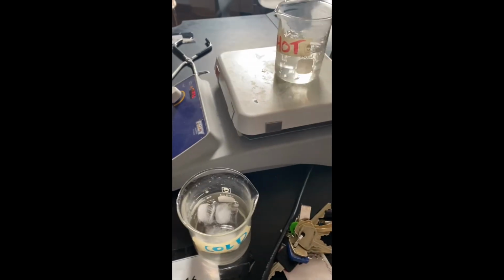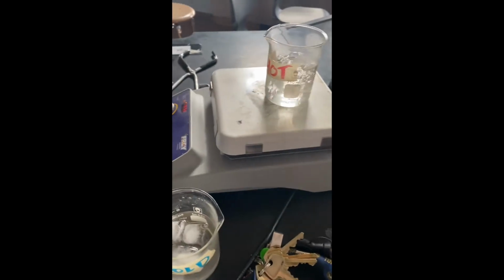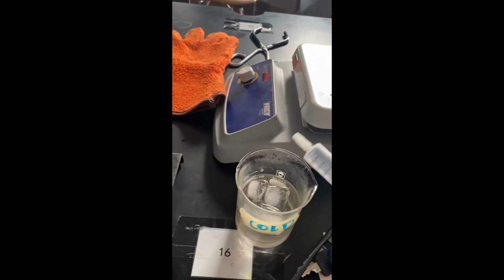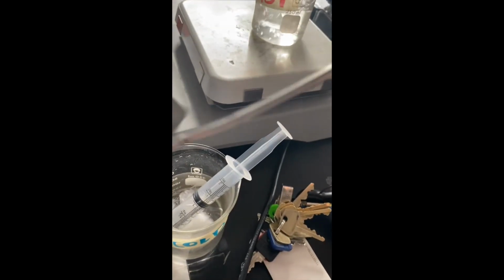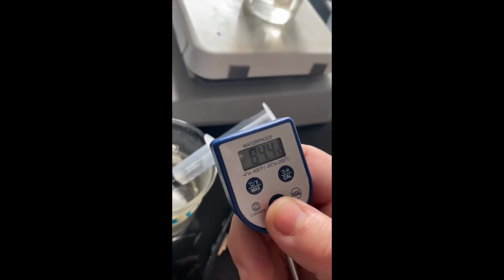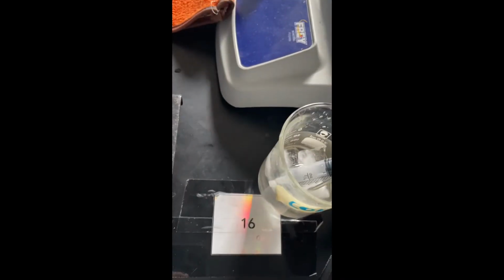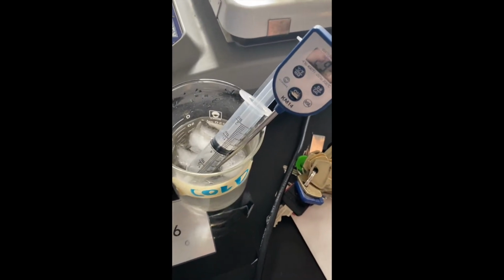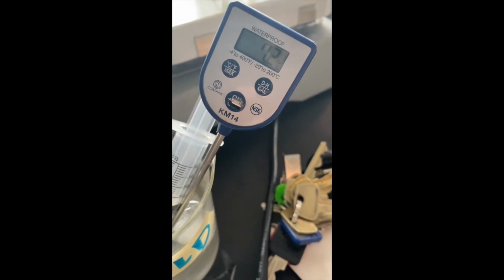air and temperature. What you're going to start off is put on your hot plate, get that hot water ready to go. You'll take our syringe, put it in the cold water, and take the thermometer, turn it on, make sure it is in Celsius. This is Fahrenheit. If it is Fahrenheit, just click it to change to Celsius. Measure the temperature of the cold water. Right now our water is about, give it a second to cool down.